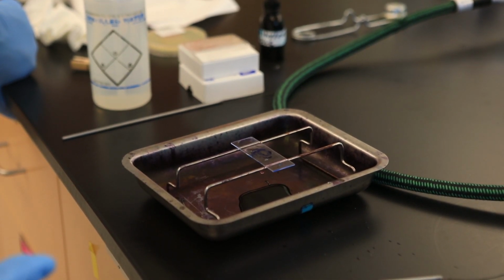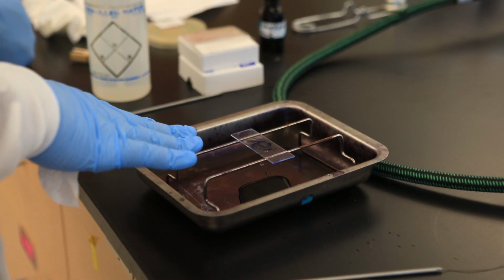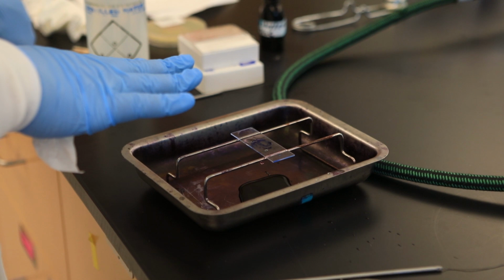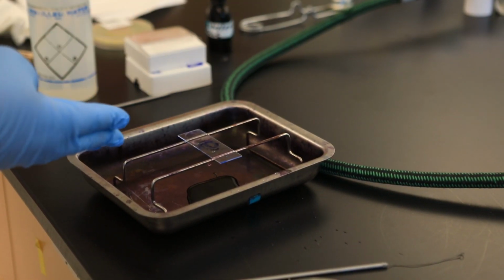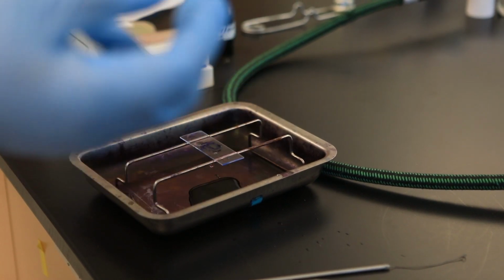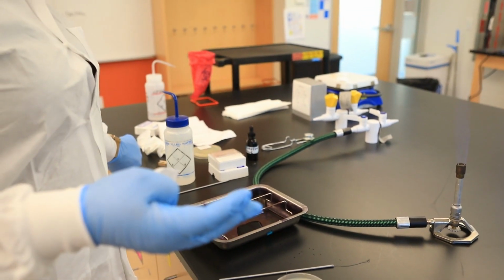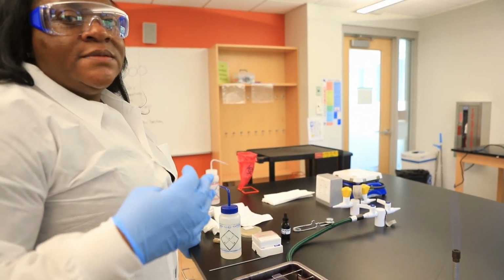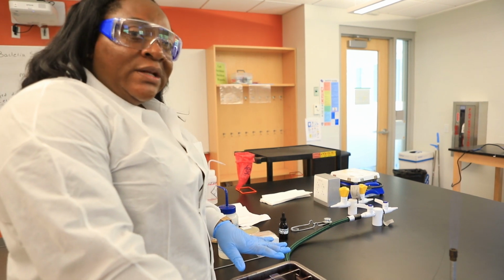And which lens from the video on microscopes do you observe your specimen at first? Remember, it's the 4 times. So you start with the scanning lens first, so that you can first locate where your smear is, and it gives you a brief overview of your actual smear. Then you start going to the 10 times, 40 times, and then you should end on the oil immersion lens.